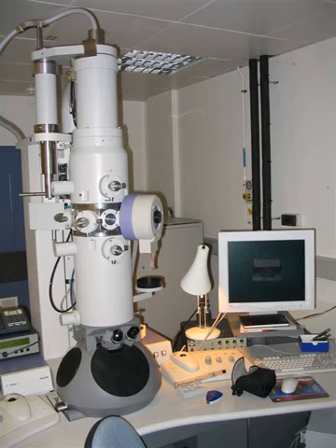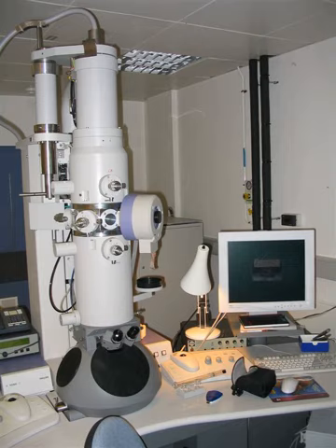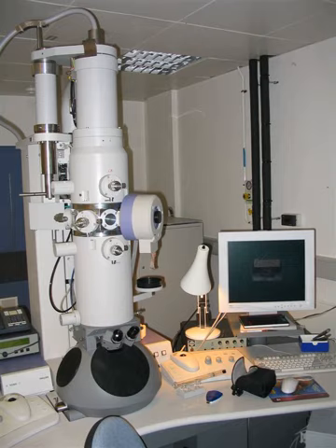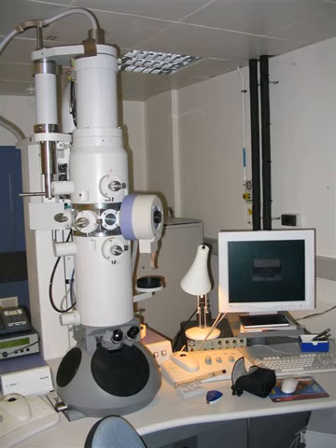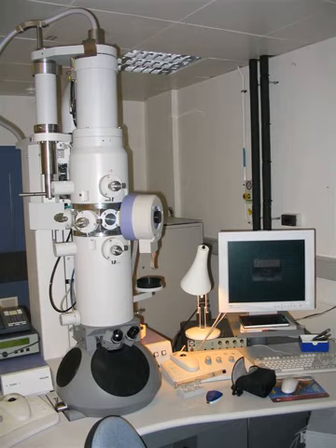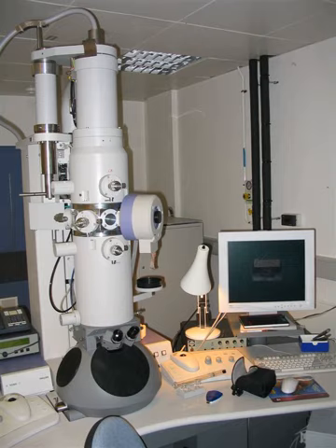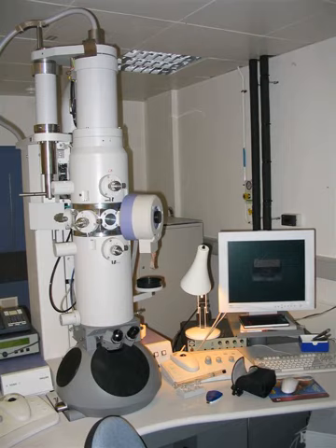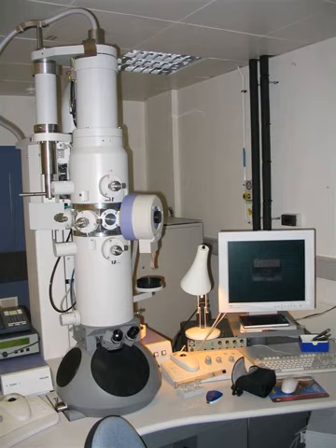Siemens produced a transmission electron microscope in 1939. Although current transmission electron microscopes are capable of 2 million power magnification, as scientific instruments they remain based upon Ruska's prototype.